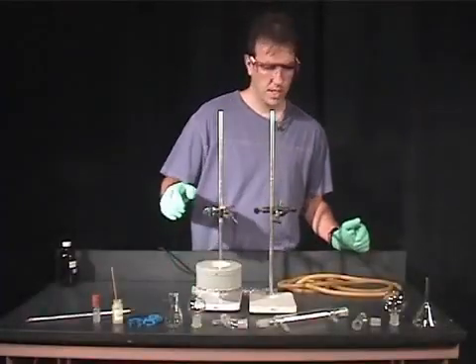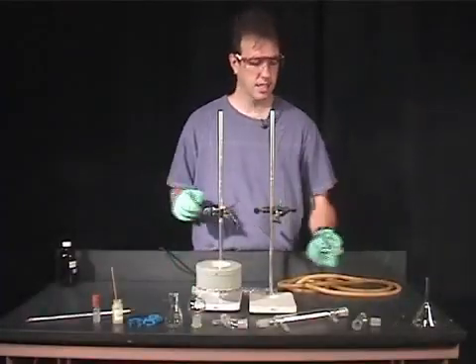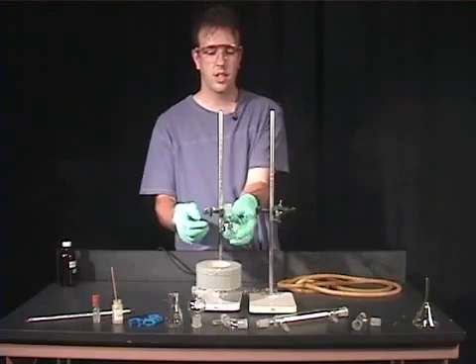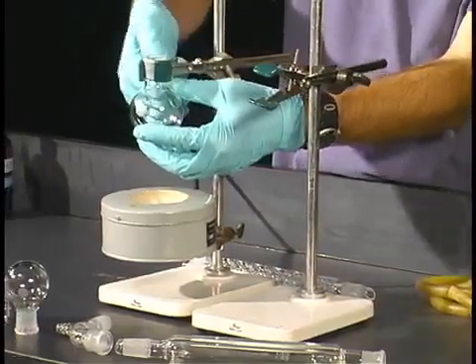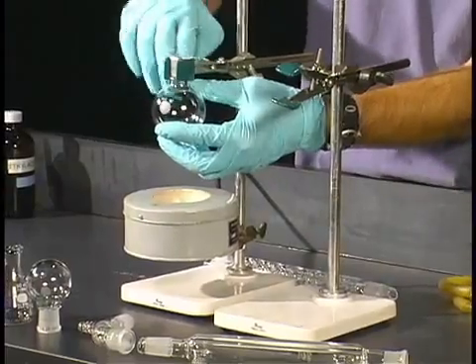So I'm going to set it up from the beginning, and we'll initially start with, in this case, a 100 mL round bottom flask, and I'll secure that in one of our clamps.